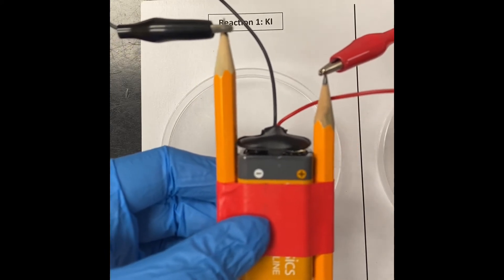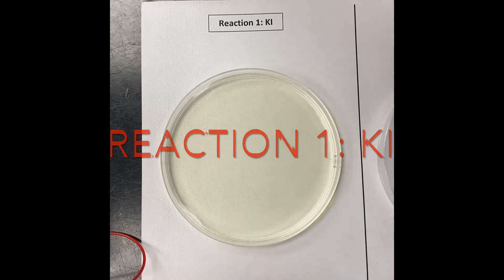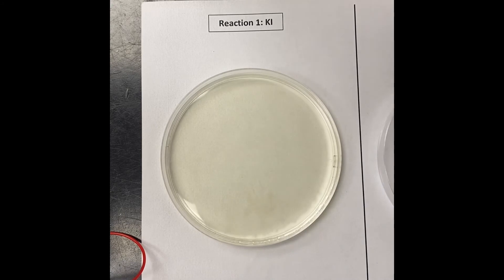So that's the initial setup. Here is reaction 1. Reaction 1 contains potassium iodide solution, and I am going to add to that a couple of drops of phenolphthalein. It's slightly yellow in color just because of the iodine present. Added a little bit more than a couple of drops, but that's fine. We're not doing any quantitative work here. This is more a qualitative situation. The reaction would be the same either way. The phenolphthalein is just an indicator.